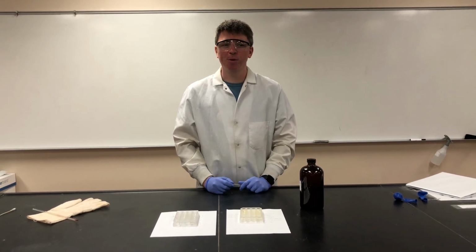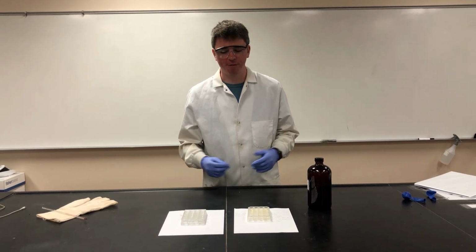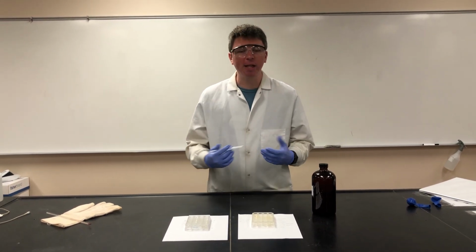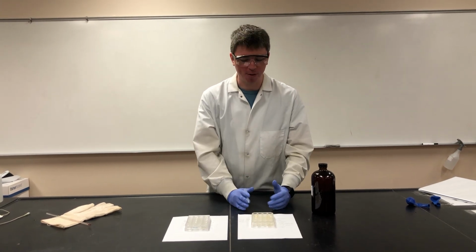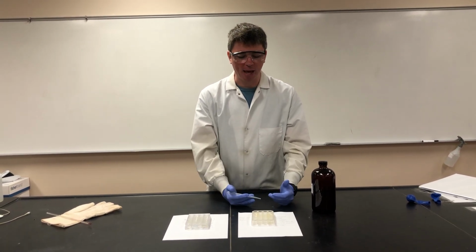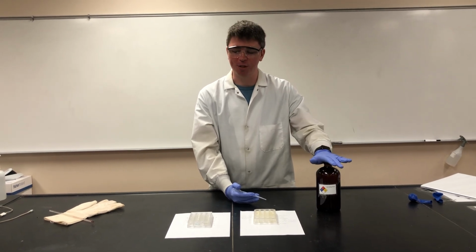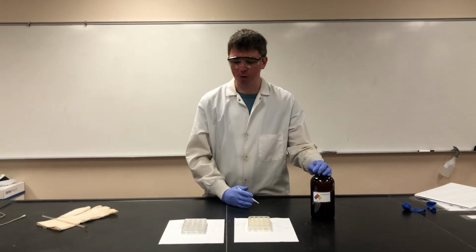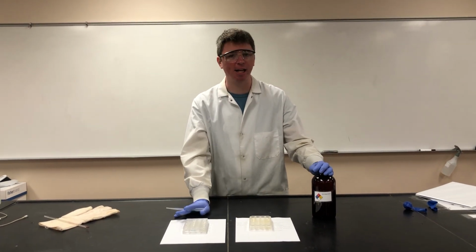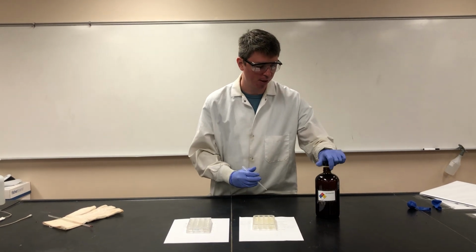Hi guys, and today we're doing an experiment based on pH, which is a measure of the acidity of different materials. So really what we want to do is figure out the pH of a couple of different household items. But to be able to do that, we will not only need our acid-base indicator, and we're using red cabbage extract again, but to really know what colors these are supposed to be, we also have some pH standard solutions from a pH of 2 up to a pH of 11.